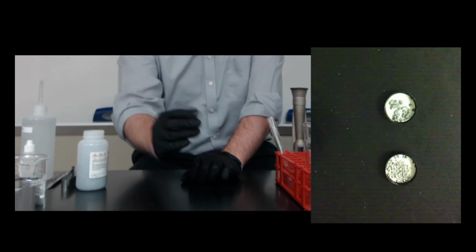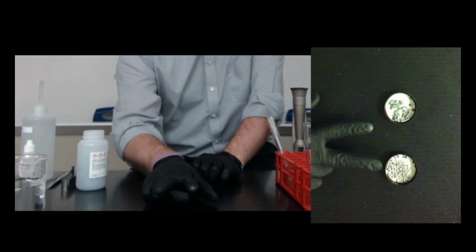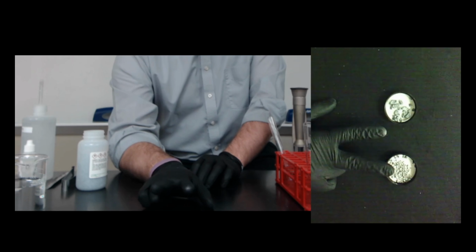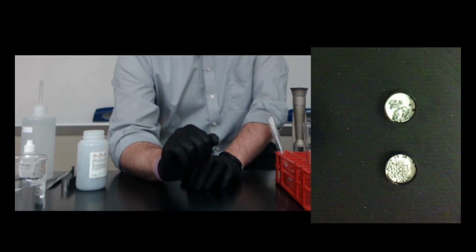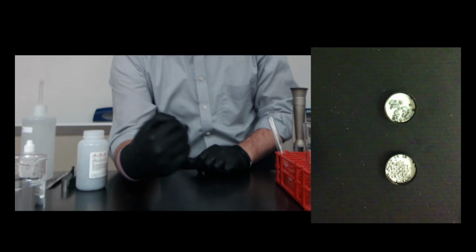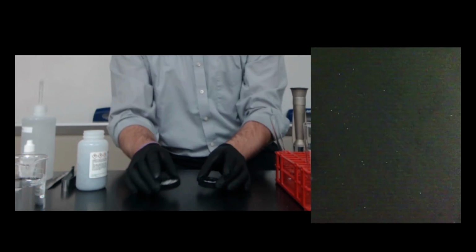So we have magnesium here and calcium here, and we're going to look at some of their chemical properties and what they have in common. Both of these are group 2 metals, alkaline earth metals, which means they have 2 valence electrons. They're going to have an oxidation number of +2, meaning they lose those 2 valence electrons and become positive with a charge of +2. Let's take a look at some of these properties.